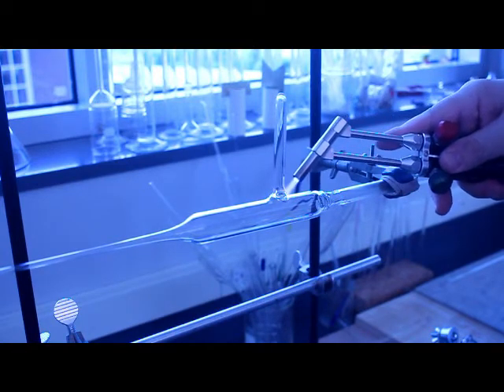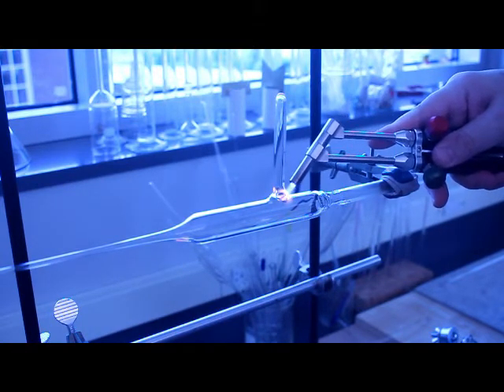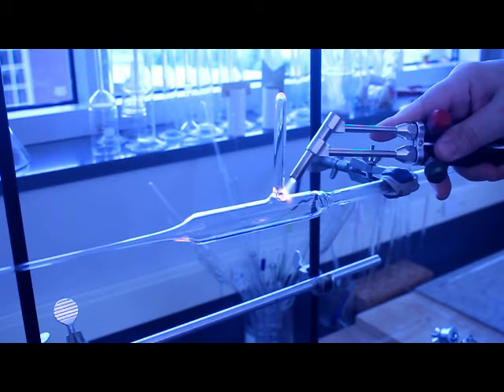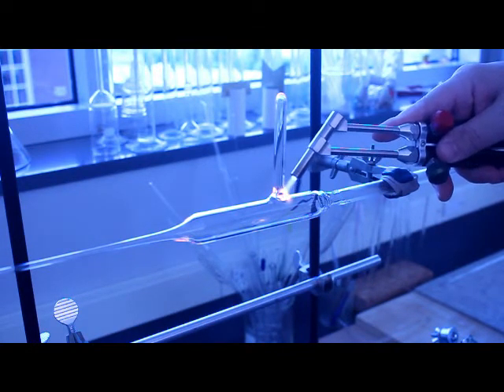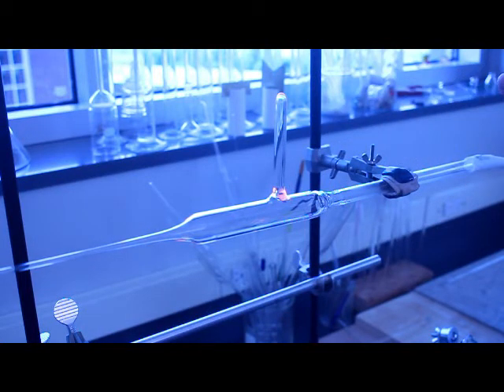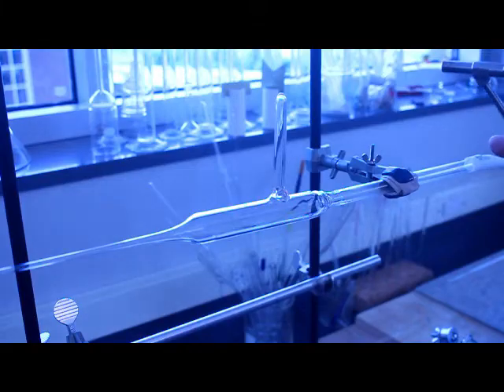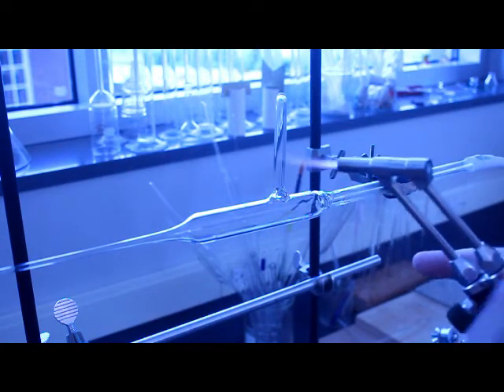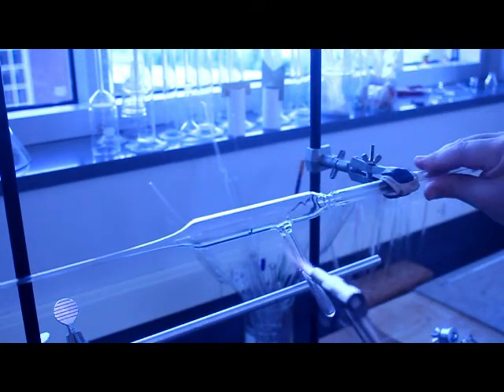Because when you start doing scientific glassblowing, if you're taking one of my classes or doing research for me or just want to learn it at Radford, you will make mistakes, you will have things go sideways on you and it'll be very frustrating, very annoying. But as you can see from this video if you just keep working at it you can be less terrible at glassblowing. Again I'm a chemistry professor, I'm teaching chemistry students. The goal is not to become master glassblowers, the goal is to become proficient in scientific glassblowing to do what needs to be done in the research laboratory and that is critical.